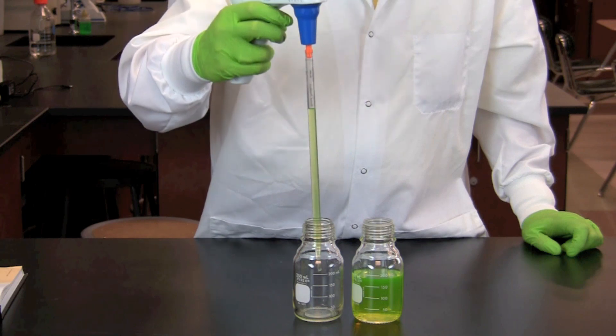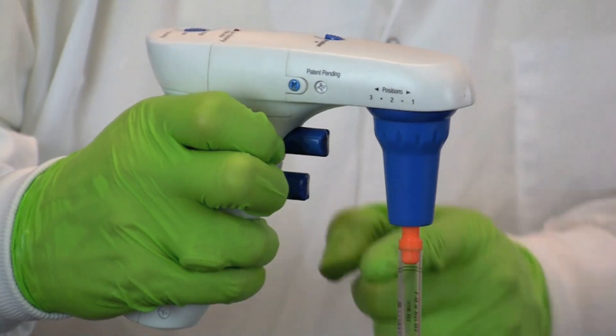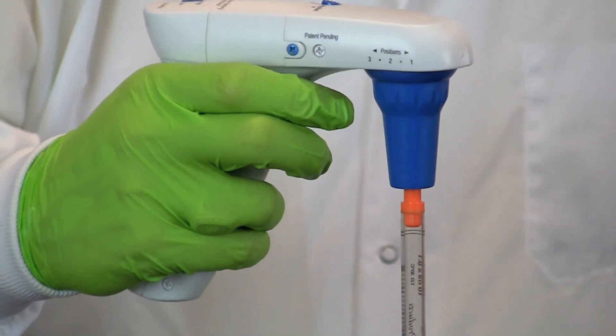Next, place the pipette tip into the target container. Slowly press on the exhaust button until all of the solution has been transferred.